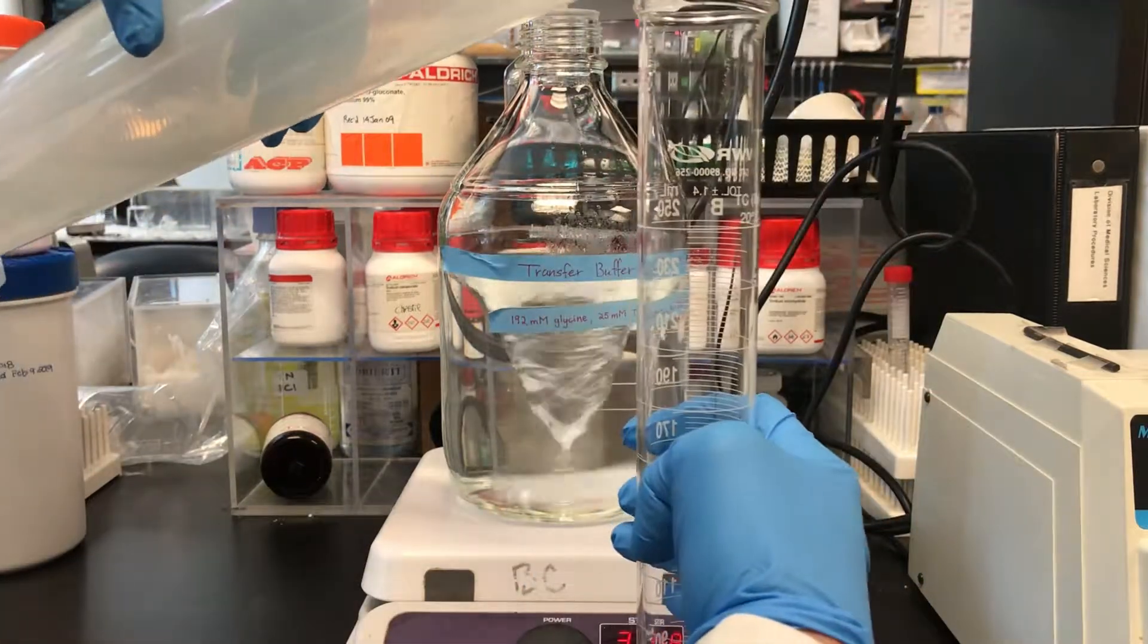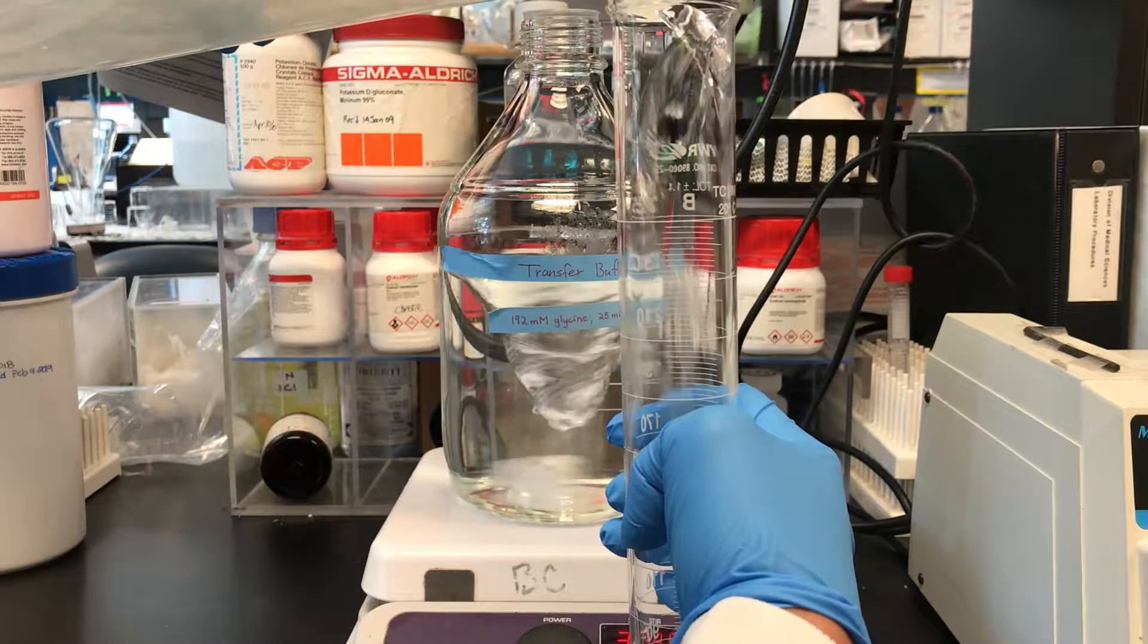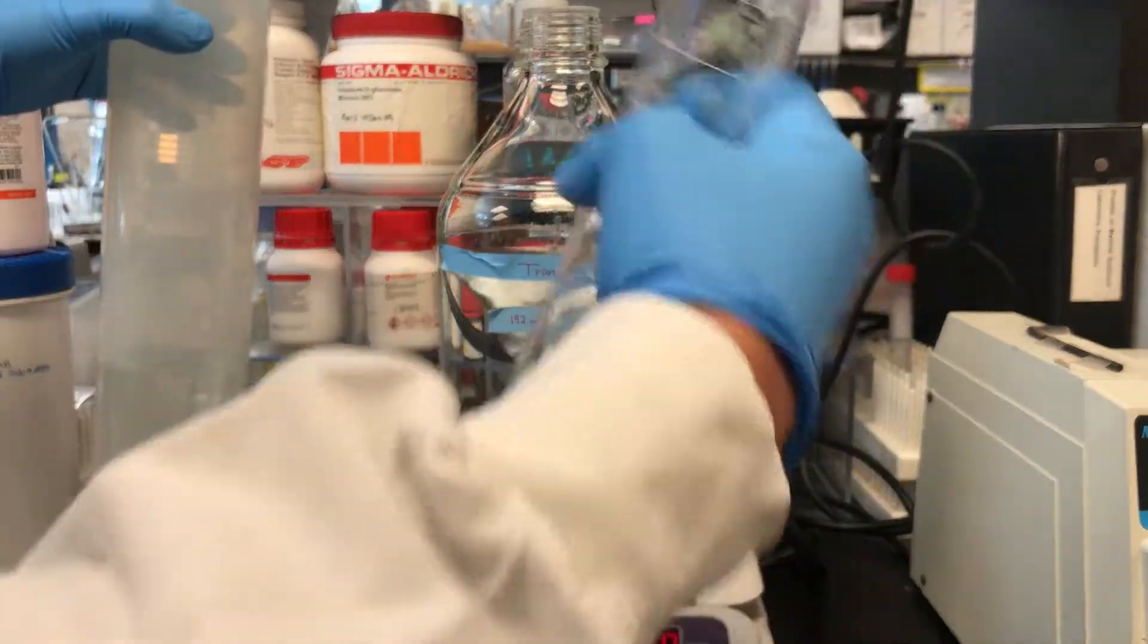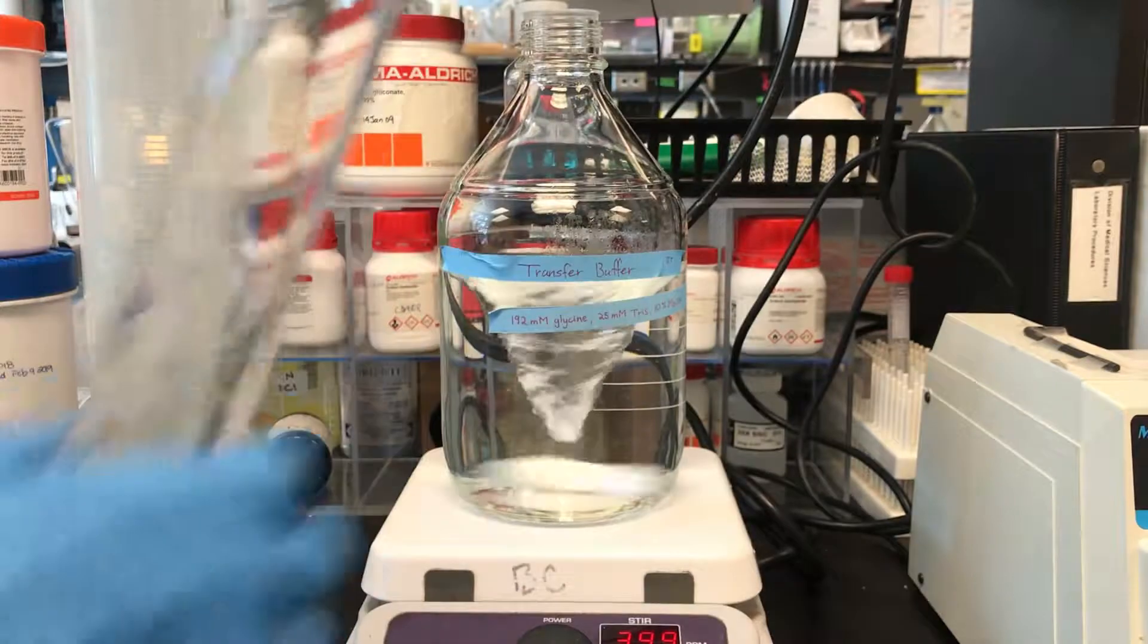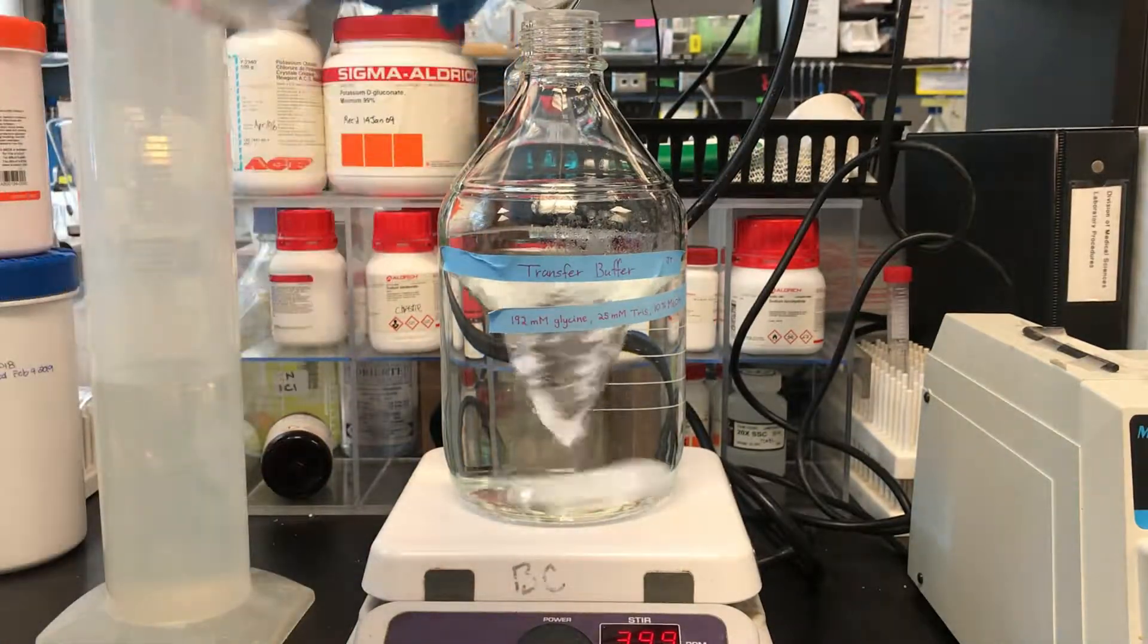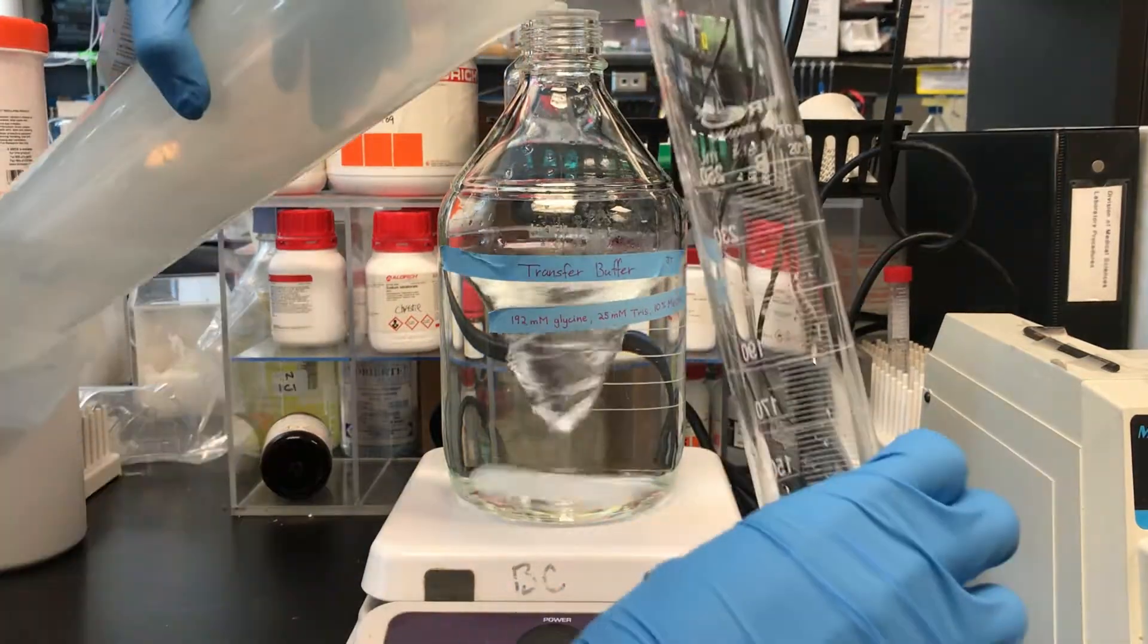Use some of the distilled water to rinse the used graduate cylinder of methanol into the buffer bottle until no remnant of methanol is present.